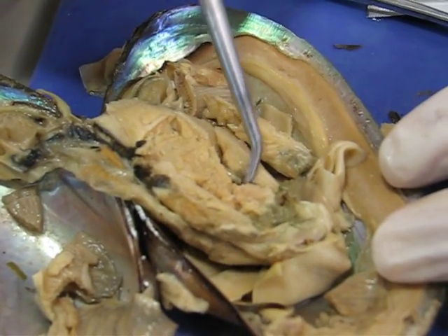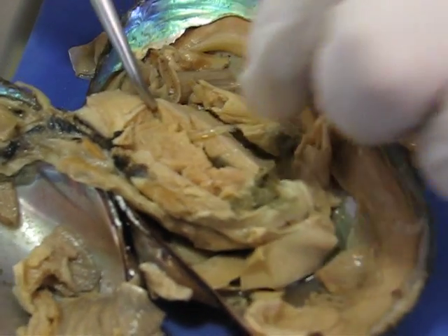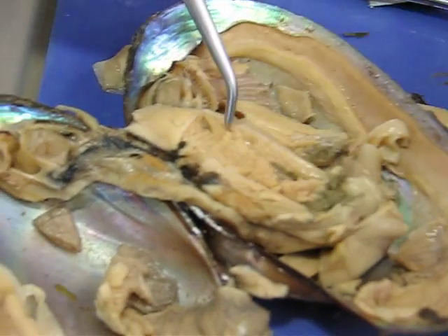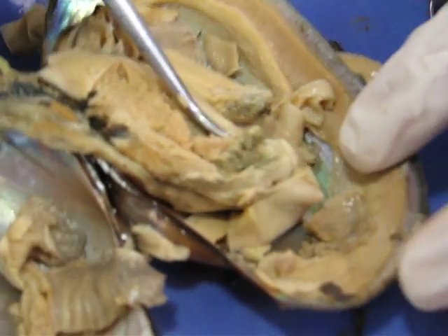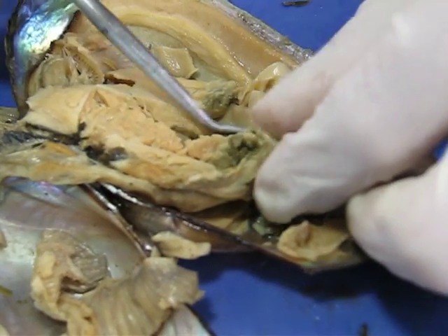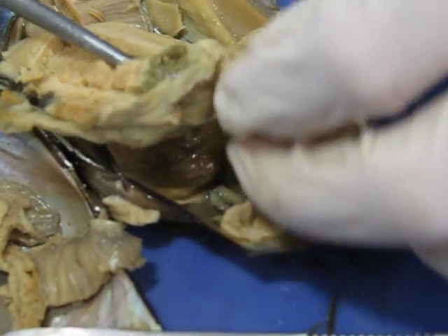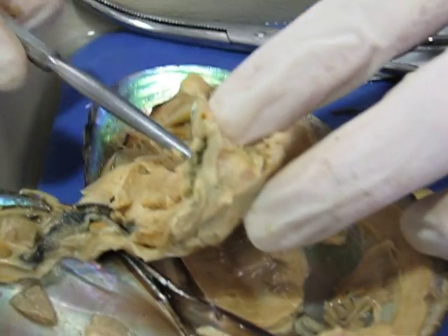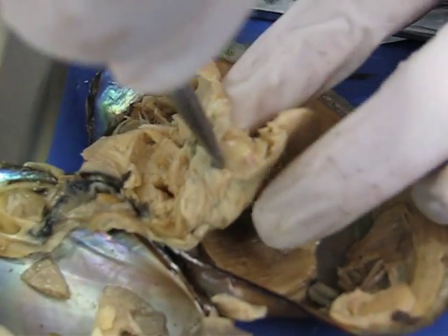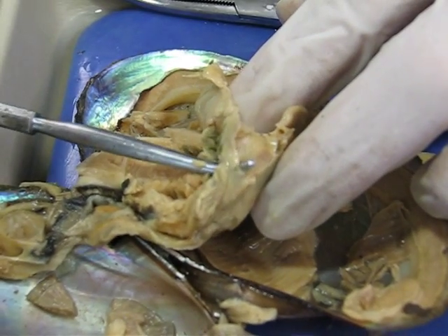Coming in through this part, there's a thin, flexible tube here, and that's called a crystalline style, and that moves back and forth like that. If we continue on through here, through by the labial palps, somewhere right about in here, there's a little hole, and that's the mouth leading into the digestive tract right there.